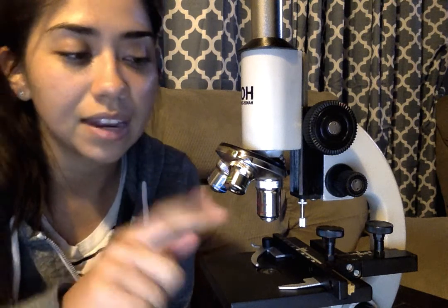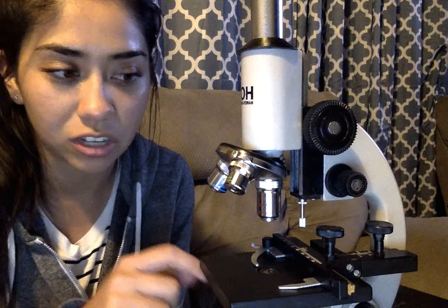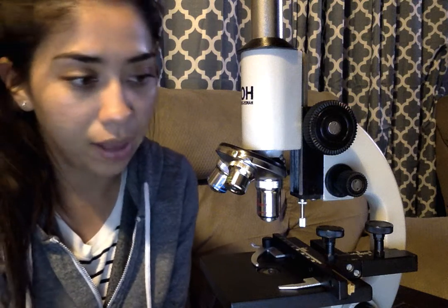These objective lenses all have different magnifications. The scanning lens is 4x, the low lens is 10x, and the high lens is 40x. To get the total magnification, I need to take into account the ocular magnification of 15x. So 15 times 4 gives 60x total for scanning; 15 times 10 gives 150x for low power; and 15 times 40 gives 600x total magnification for the high power lens.